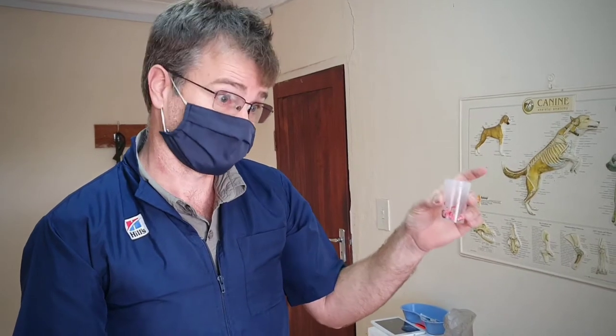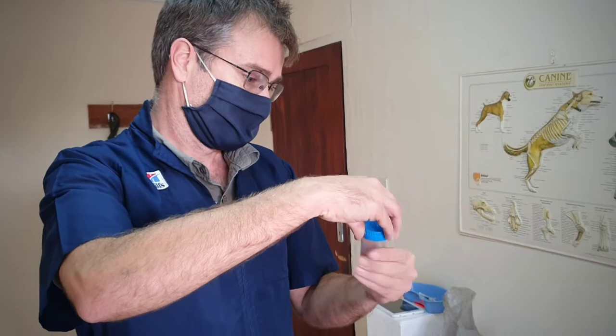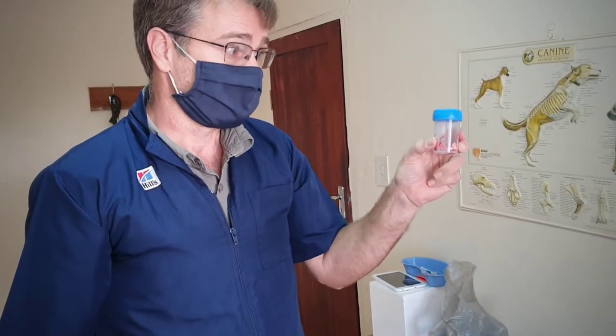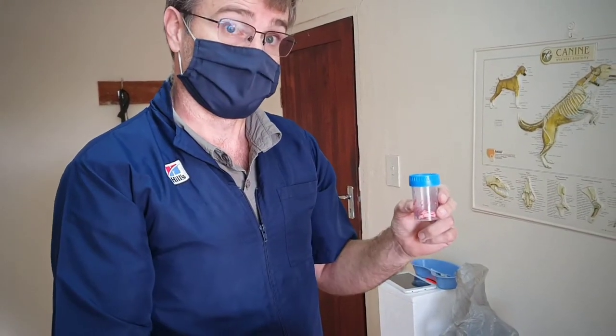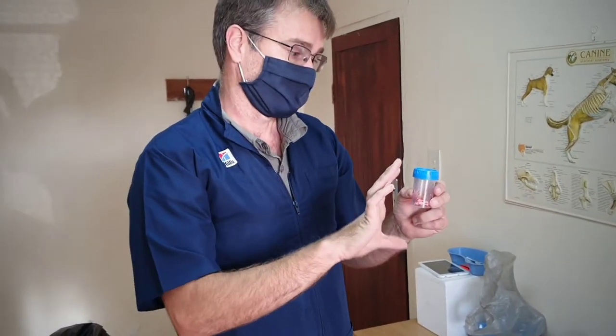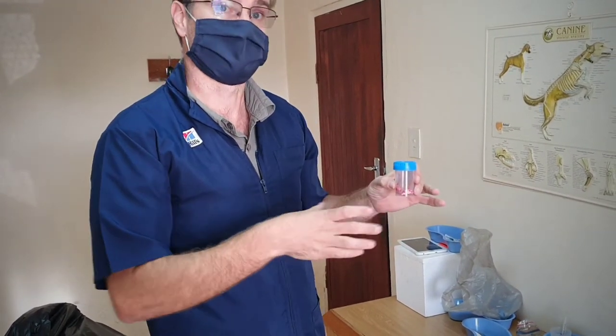If you're not going to be able to ship it soon and don't have glycerosaline, then perhaps you can put it in the freezer like that. Then remove it, either send it on ice or by air — make sure it's safe before you ship it. Also, once you've sealed the container, these little sample bottles do leak a bit. So make sure you have a triple bag — I put them inside a rectal glove that I've tied off, tied at the top and bottom, and then wedge it into my carrier cooler box that I'm sending it upright with ice packs inside.